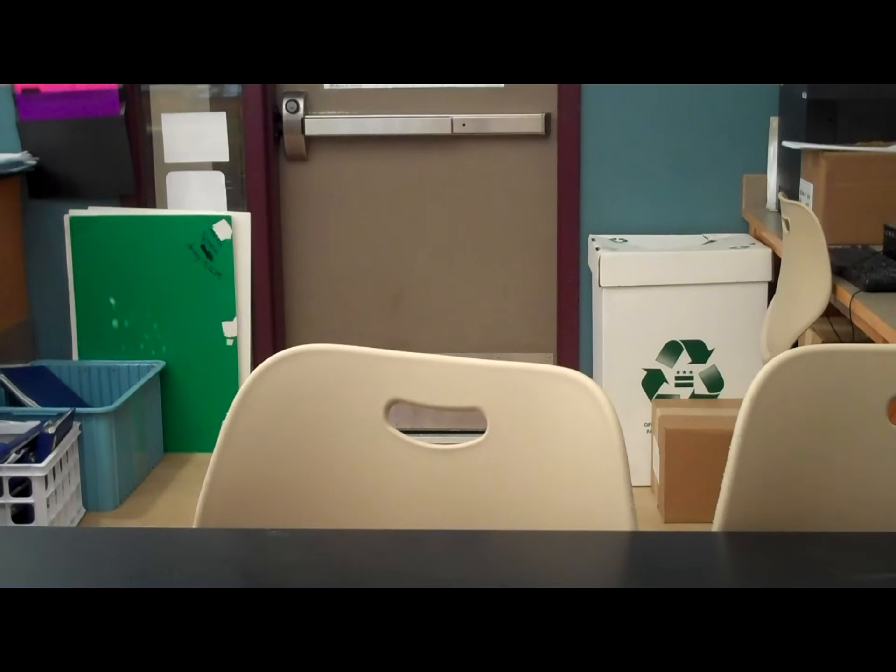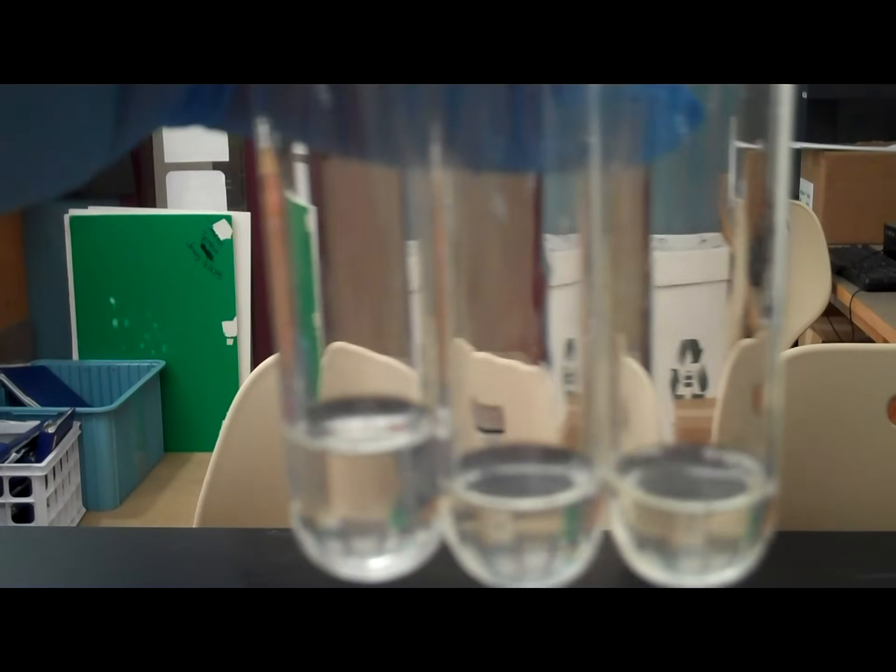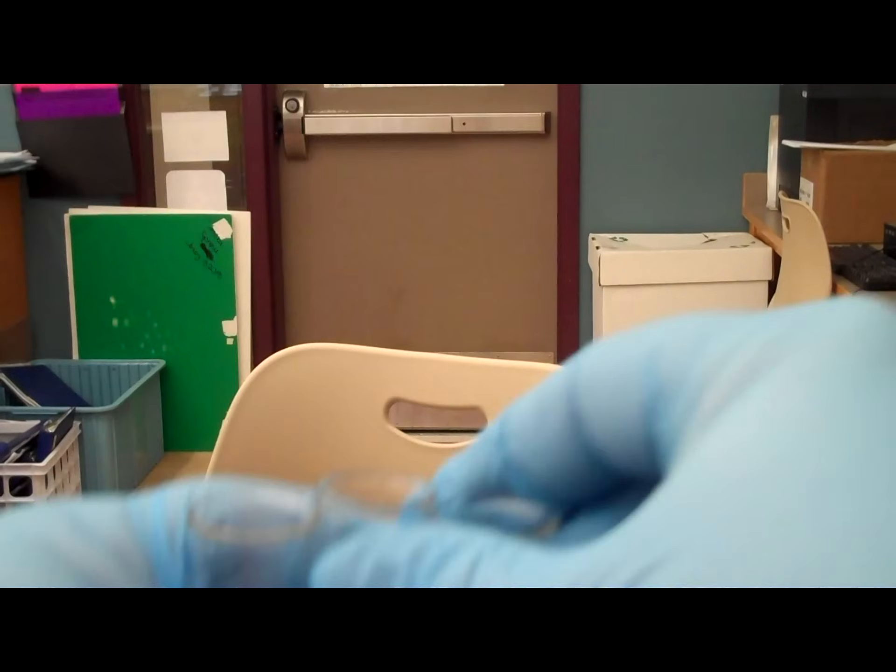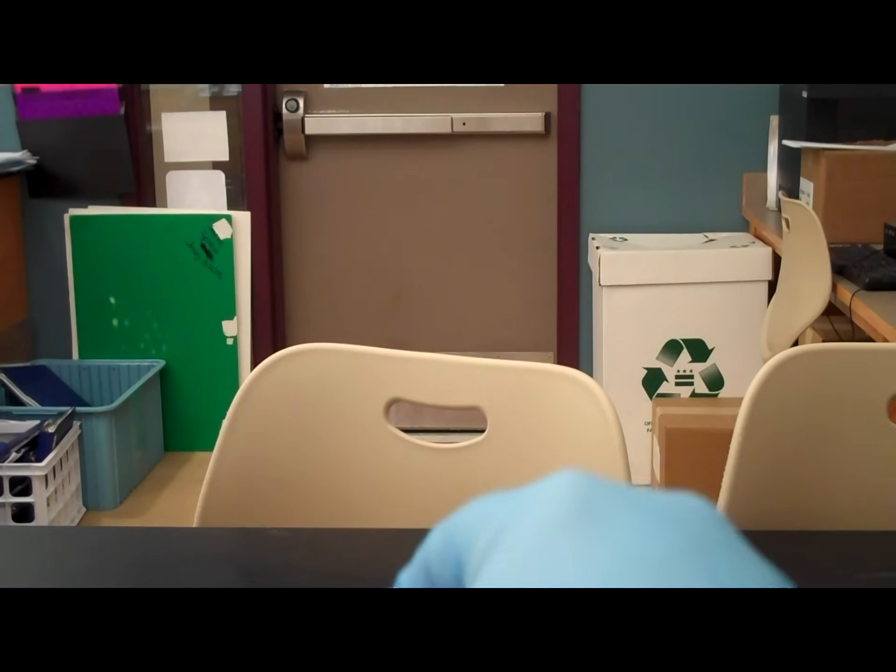And so, I'm going to grab me a new pipette. And I'm going to go with the dropper and add some distilled water to the other tubes until the volume is roughly the same in test tubes B and test tube C. Now, this is just regular distilled water. Now, I want to make sure my volumes are the same. We don't want volume to be a factor in our lab. So, we want to make sure we account for the volume difference. So, we've just added plain old distilled water to that. I'm going to put that aside.